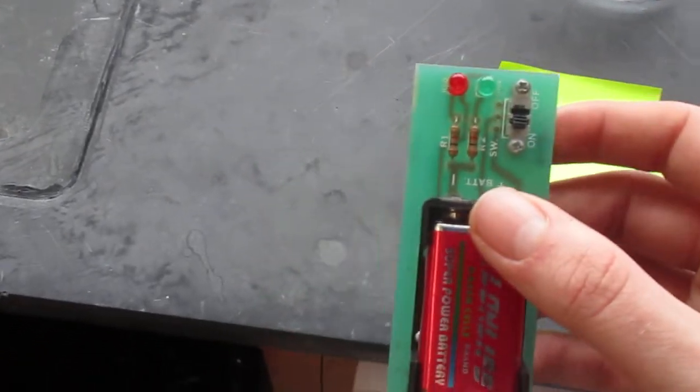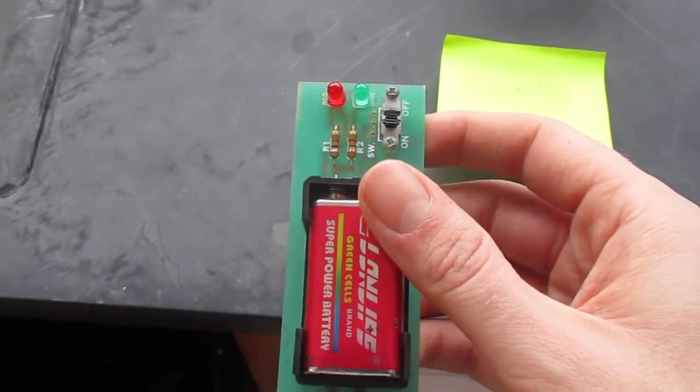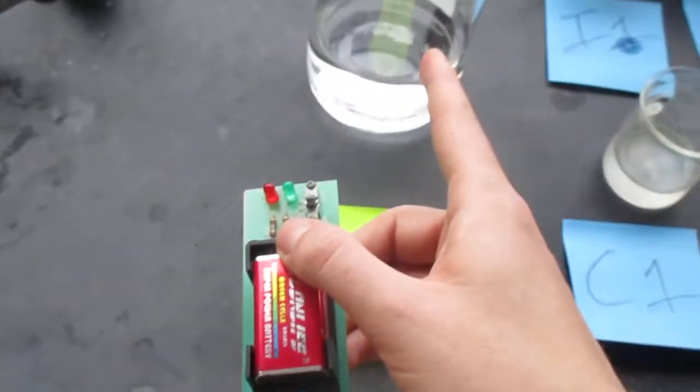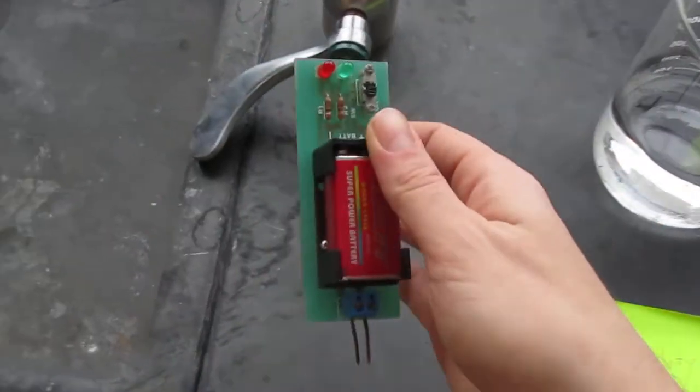That is because water in fact does not conduct electricity. This is pure water, not from the tap.